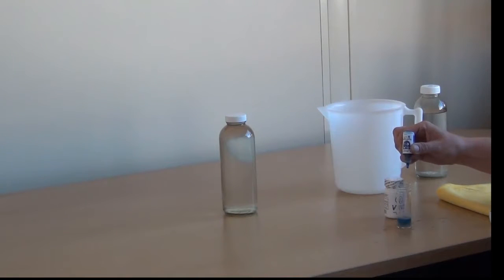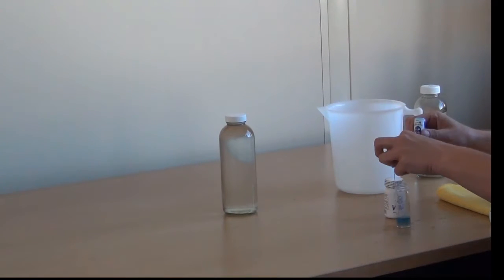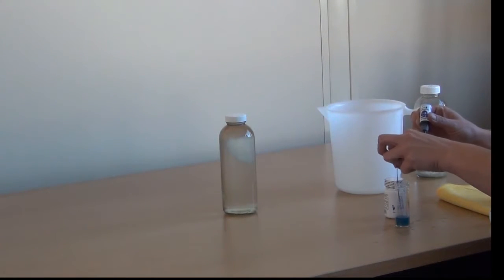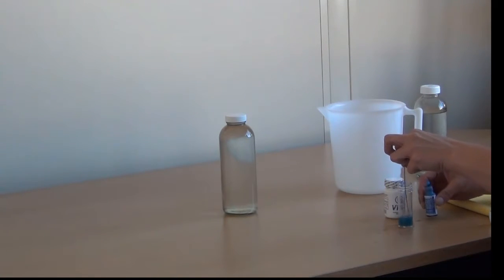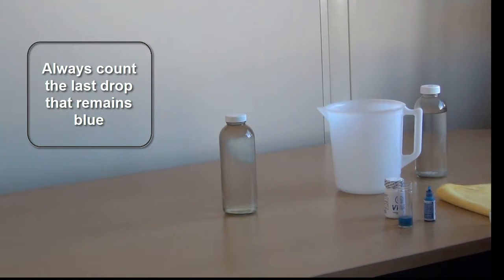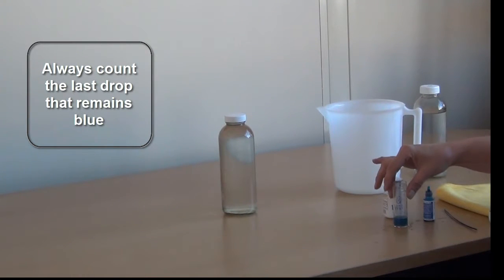Twenty-seven, twenty-eight, twenty-nine. Twenty-nine drops and the twenty-ninth drop did not turn clear. Always count the last drop that remains blue.